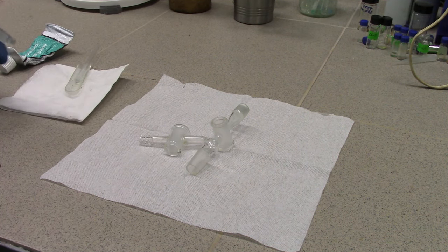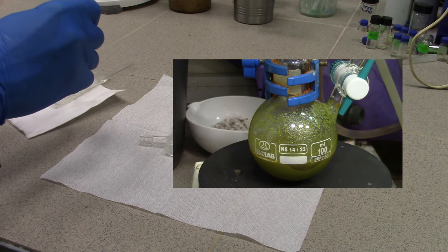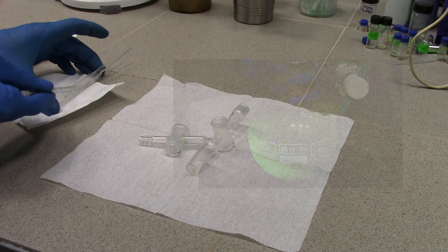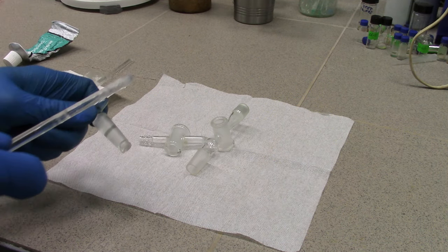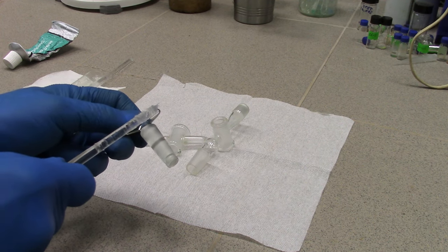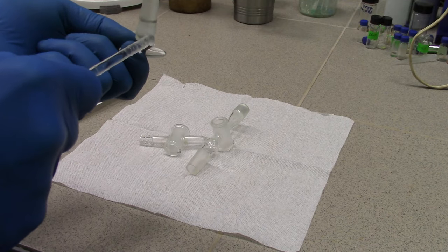First of all, I have prepared a fresh portion of tetrakis in DMSO. I used a Schlenk flask as before. Next, we should prepare a T-shape outlet by greasing its taps. I highly recommend Korean vacuum grease. This lube isn't expensive and pretty robust as well.